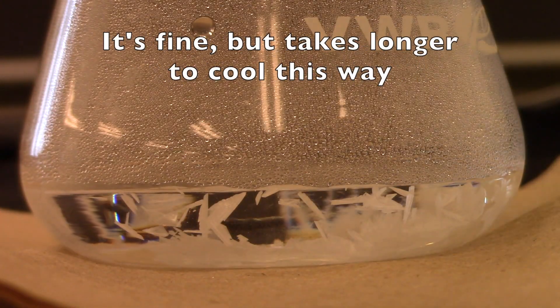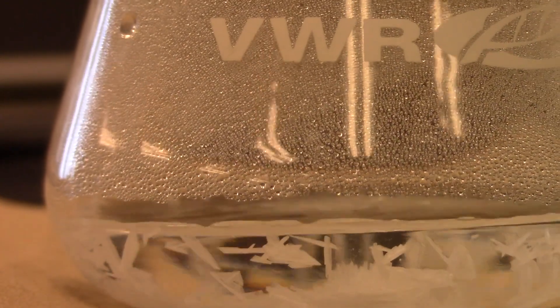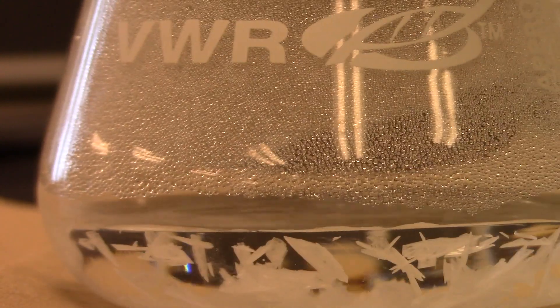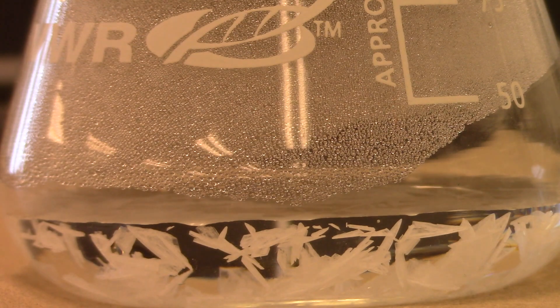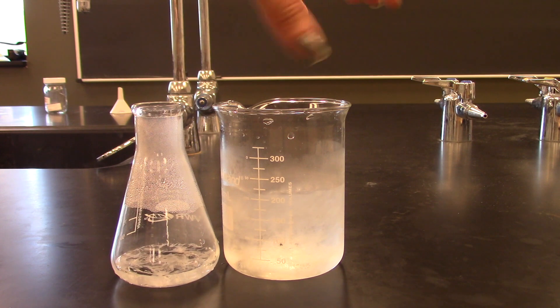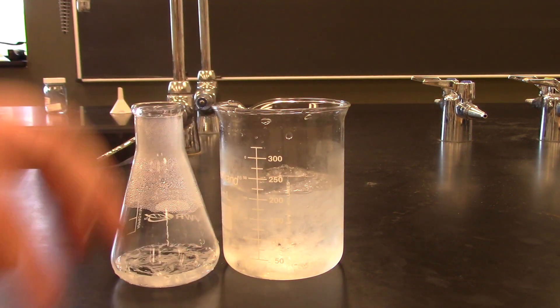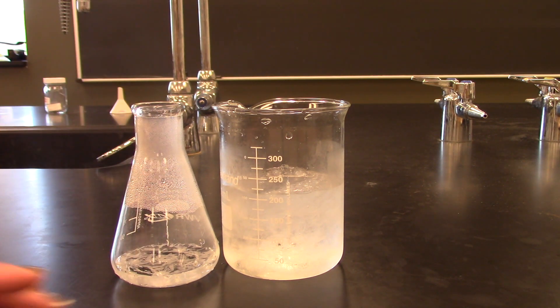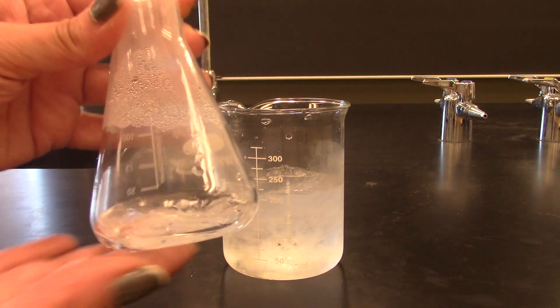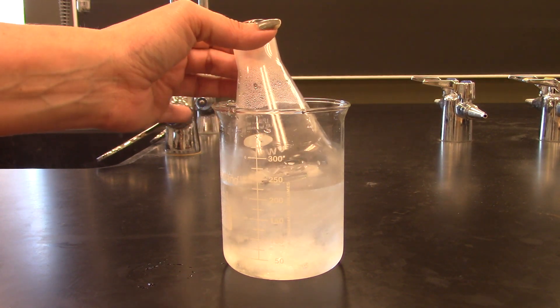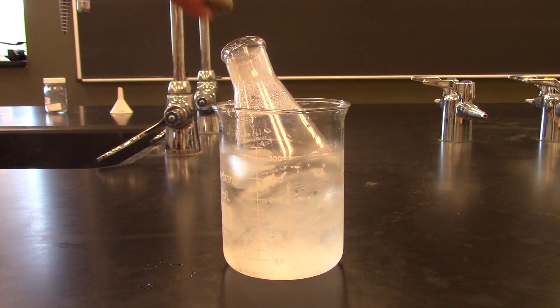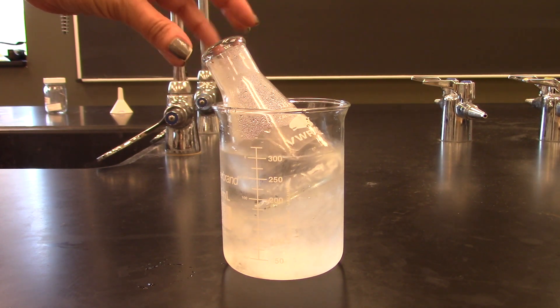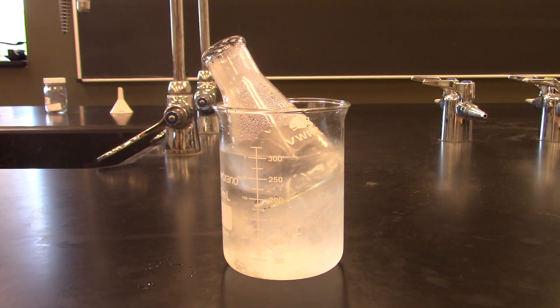Okay, so that is at room temperature now, and you can see probably you got to watch all of those crystals form. And so that's really nice, and you can see they really are much bigger than those original kind of really, really tiny crystals that we started with. So now what we're going to do is make it even colder so that we can solidify even more of that phthalic acid out, and the way that we're going to do that is by putting it into an ice water bath. Okay, so what I have here is a nice ice water bath. So this is a mixture of ice and water. You never want to cool something using just solid ice. You need some liquid in there because that's going to make a better surface contact. Every piece of this flask that is immersed in the water is going to have heat transfer going on because it's touching the cold water, versus the solid ice would leave a lot of gaps where you don't really have anything cold touching the flask. So what I'm going to do is leave this sitting in here for about 15 minutes.